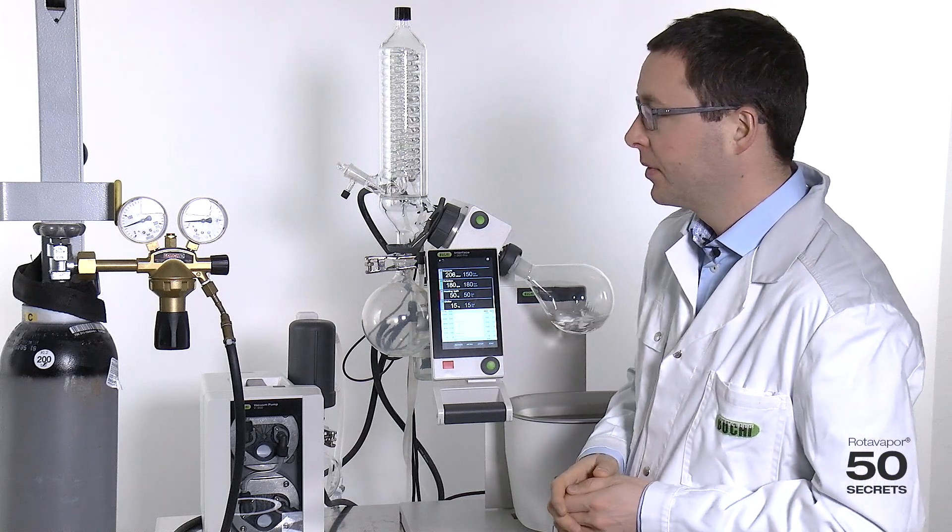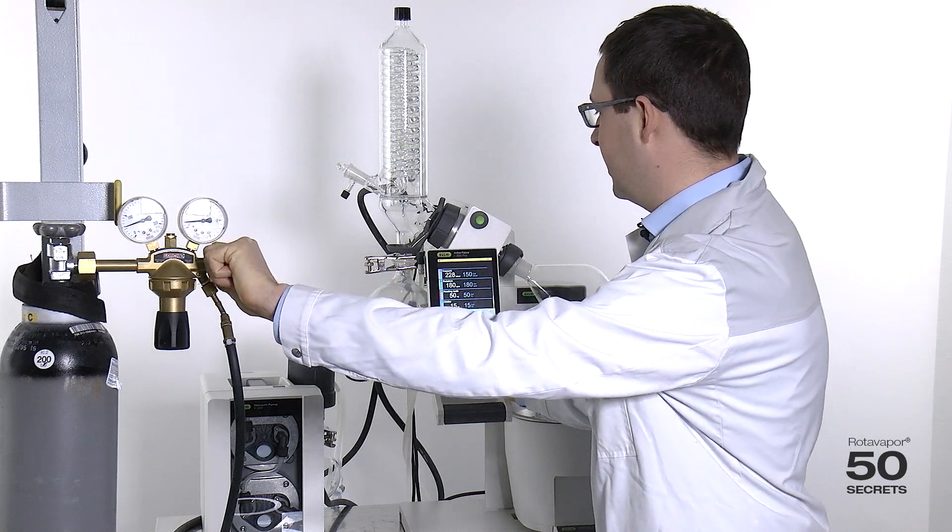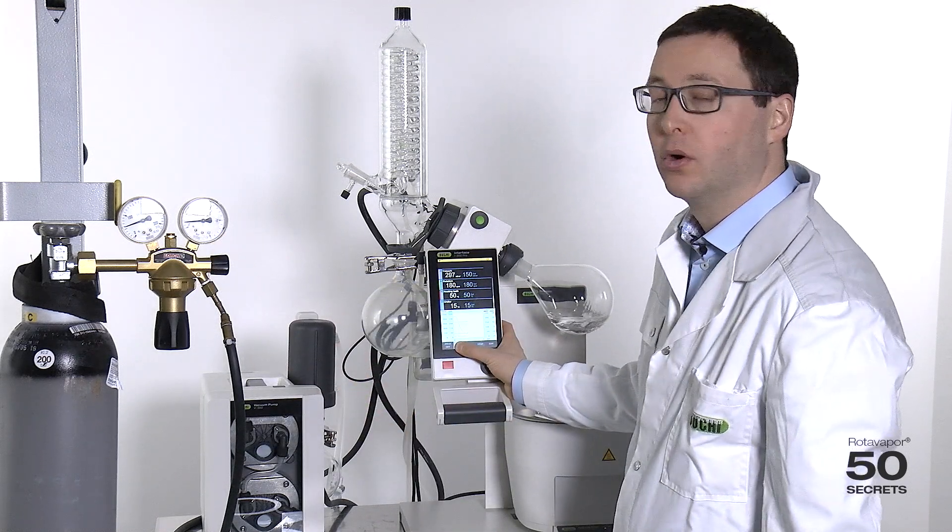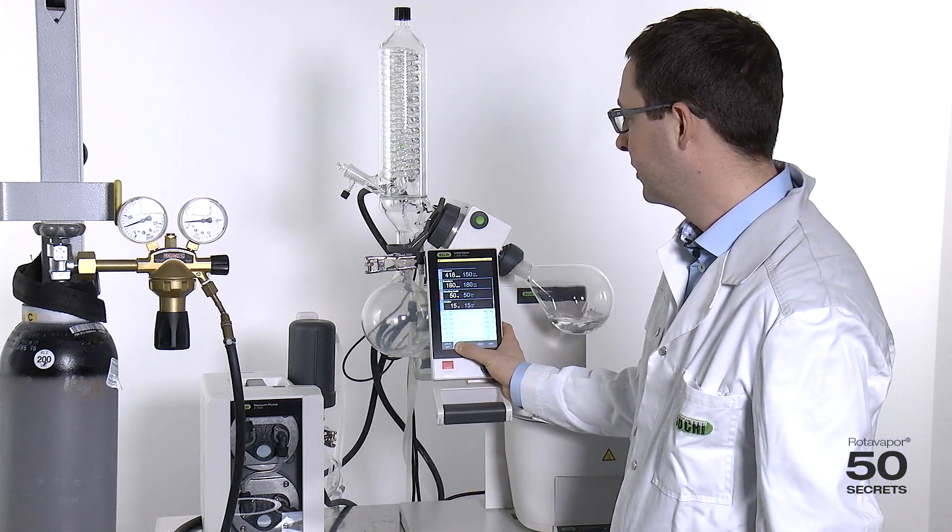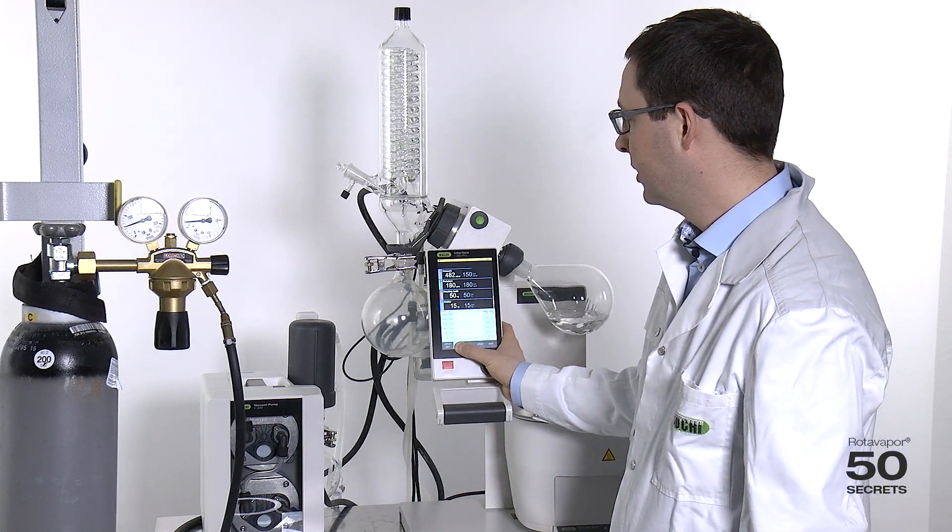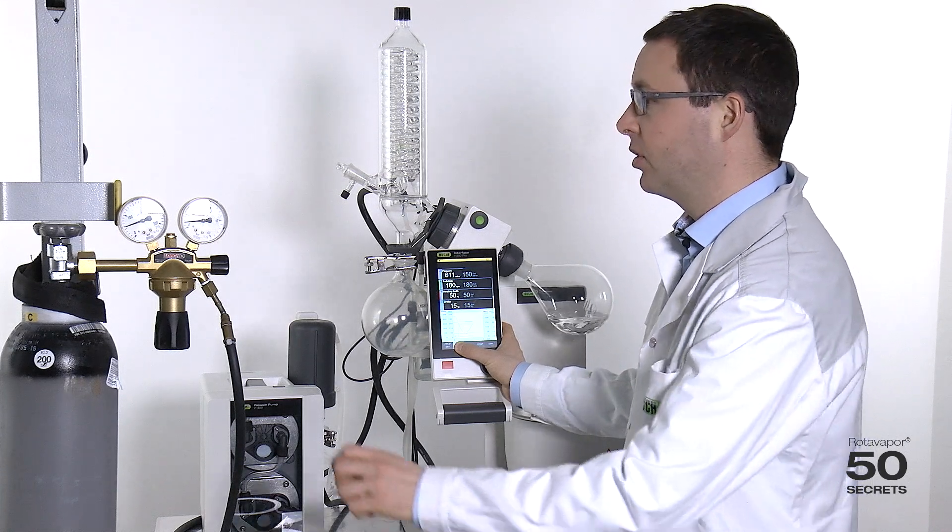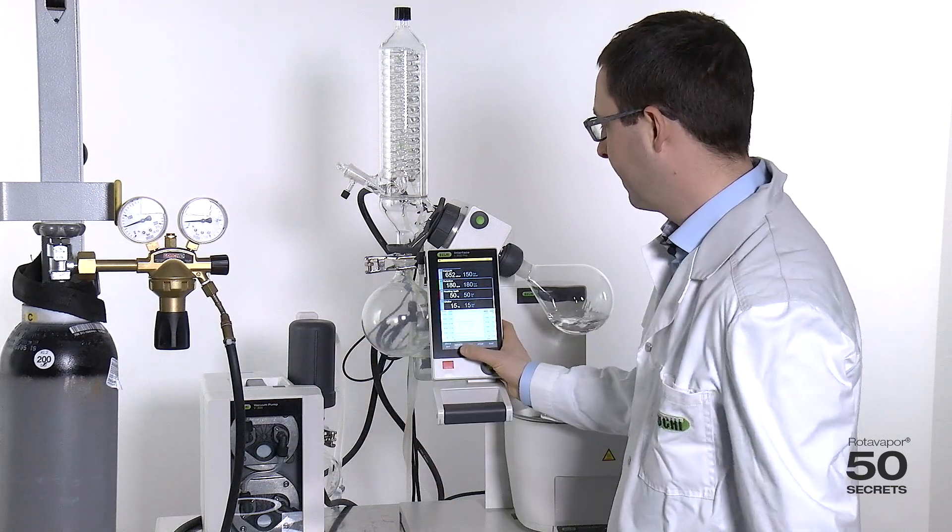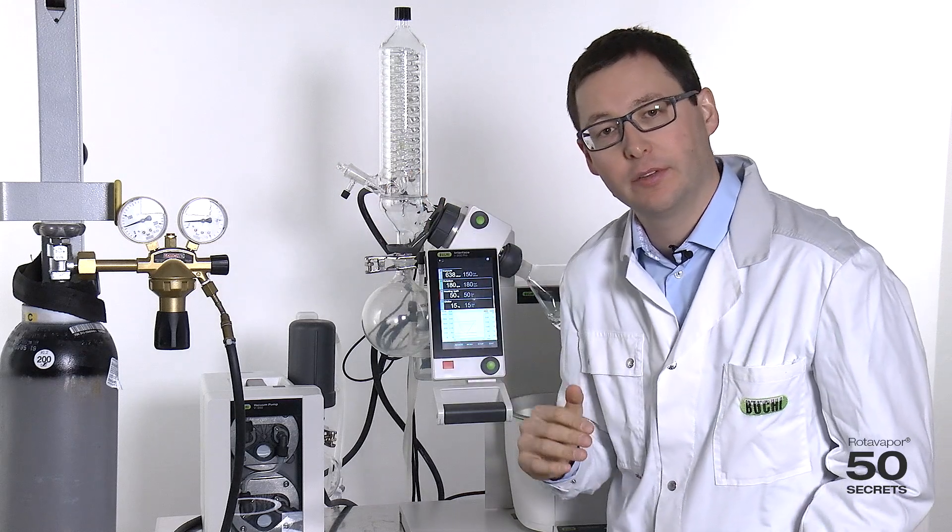So now, I will open this one and press aerate. I will go into close to atmospheric conditions. I will stop the process and I will close the valve. I will now say hold off again so it will go down with the vacuum.